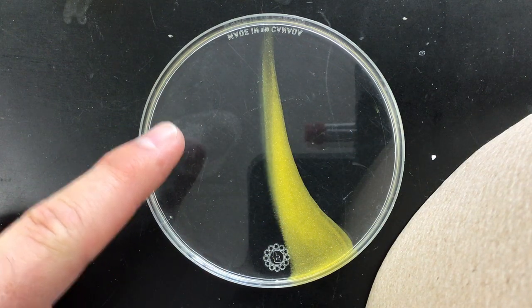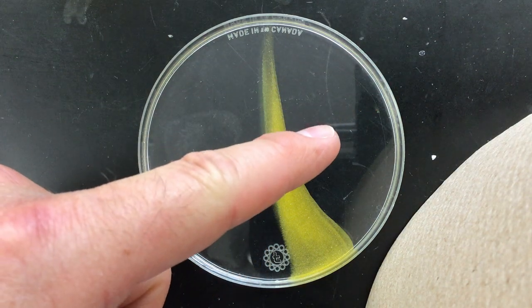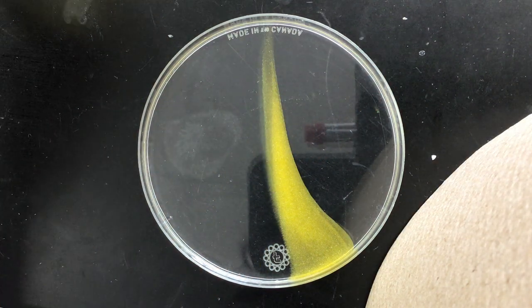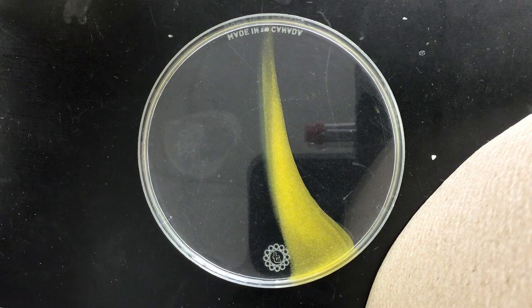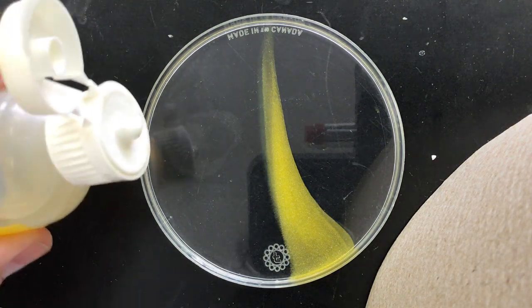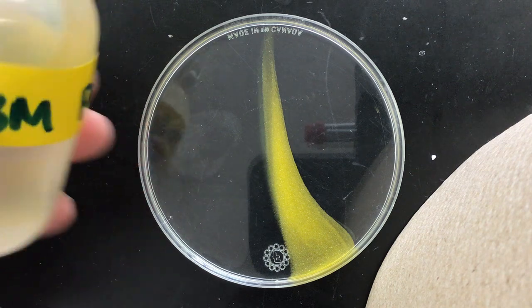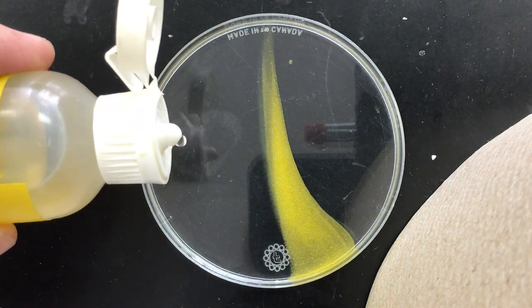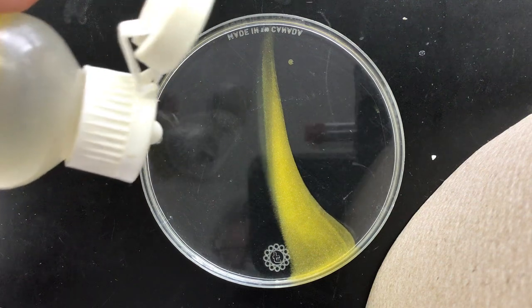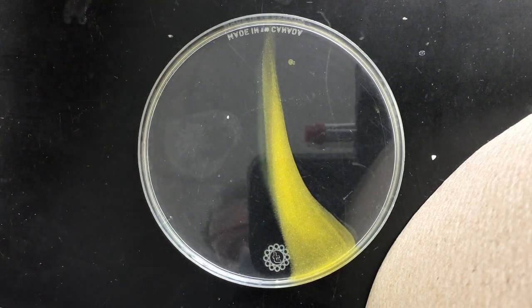So if some of the potassium iodide from the right made it all the way over to the left, then adding more of the lead solution should make more yellow precipitate. This is our lead solution here — we're going to add that to the left hand side. Get a drop going — okay, a couple drops there.